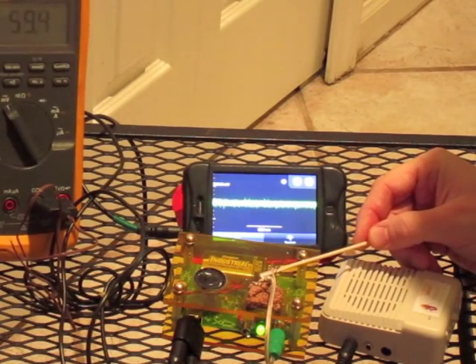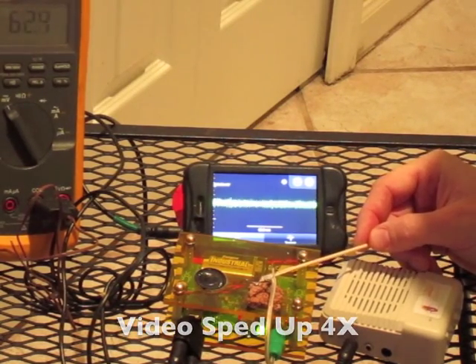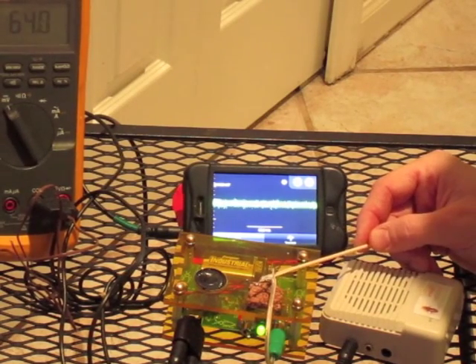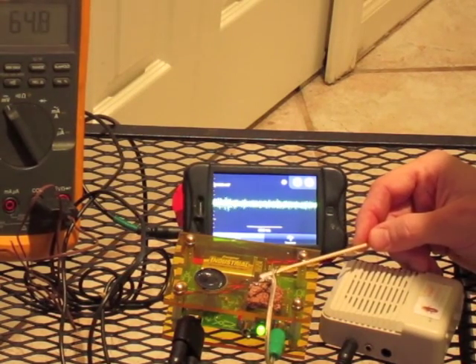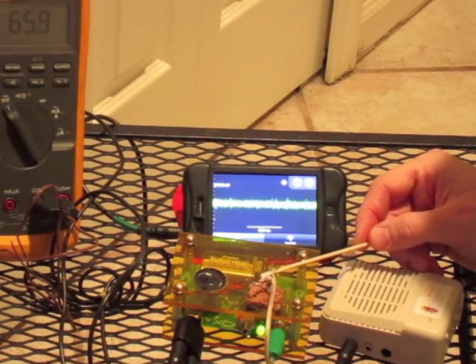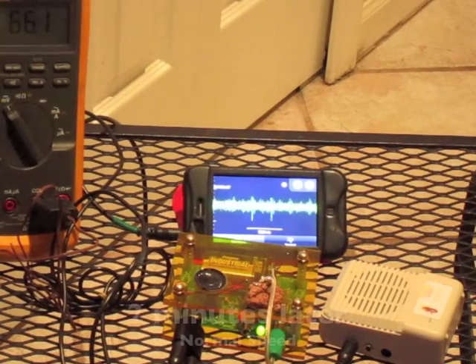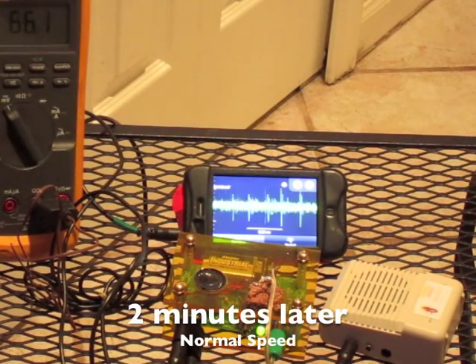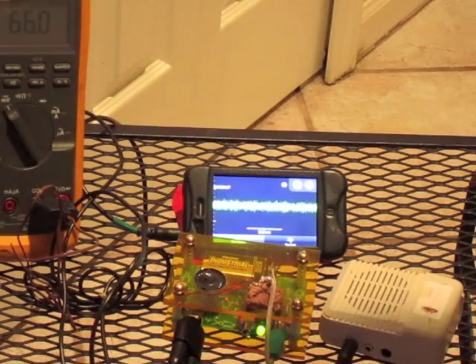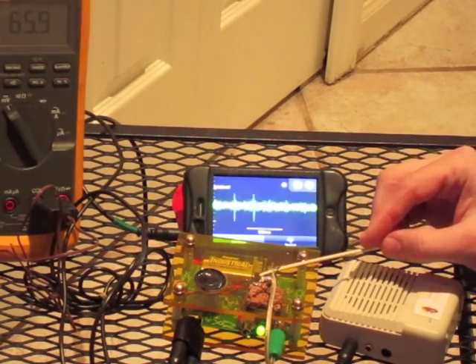I will manipulate the leg with my Q-tip and observe the neural activity on my iPhone. I'll speed this up in the interest of time for the video. It appears the neural activity has returned. Why was there a lag? You should discuss this with your students. You can see two minutes later the spontaneous activity has returned, and we have a quite healthy response to manipulation.